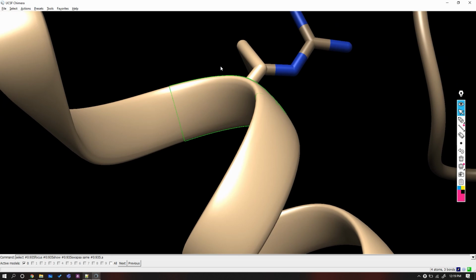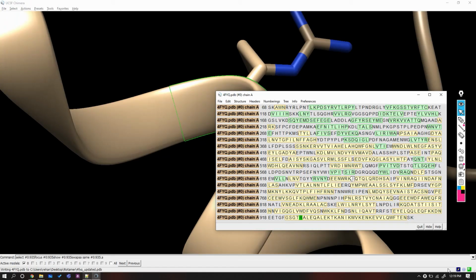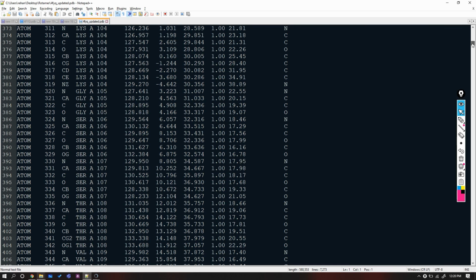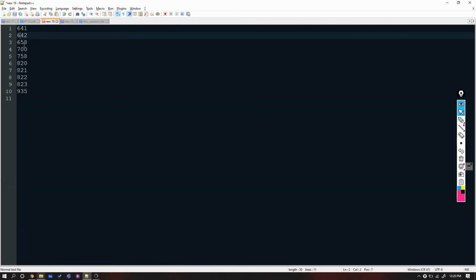Everything is done now. Definitely not residue number 469. I have told you earlier, I am leaving it to you as an exercise. Now save the PDB somewhere with a new name. Let's open the new file and check the A and B column for those residues as validation. Now you can see that those residues which were earlier seen as duplicated have now been updated. If I have left any duplicate residue, then please feel my pain with recording with this laptop.